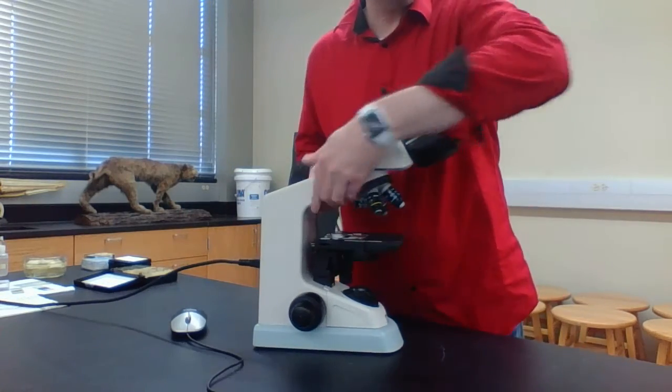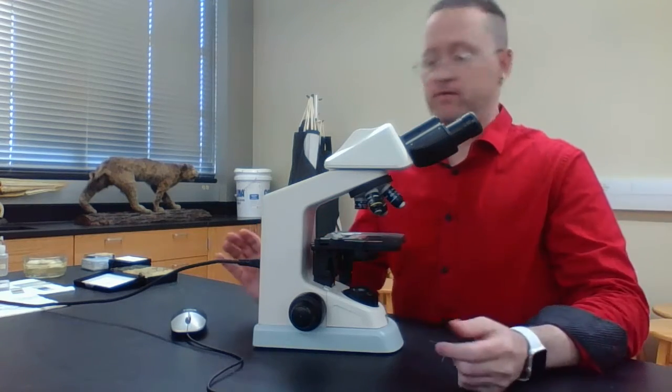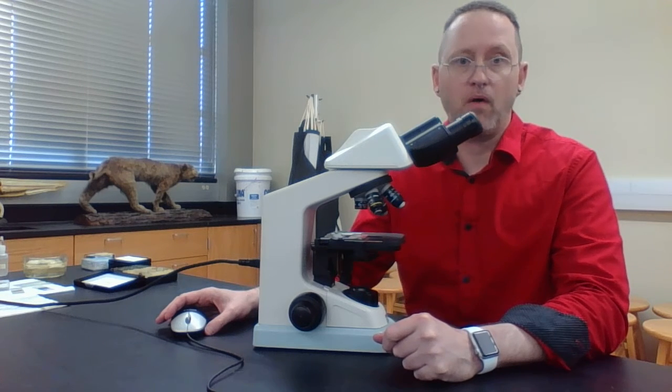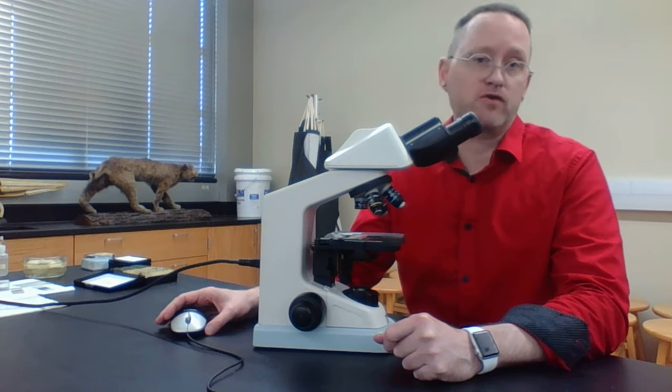The first thing I want to show you, because you may be brand new at doing this, and I do want to make a point: I can tell you how to use a microscope, but whether or not you're going to be able to use the microscope is a different story.